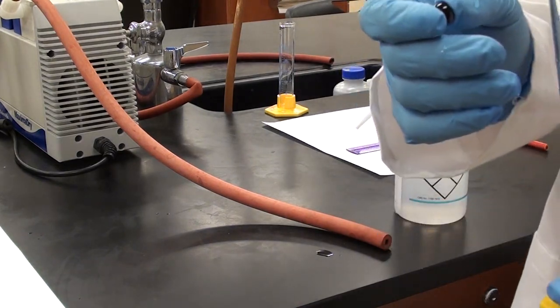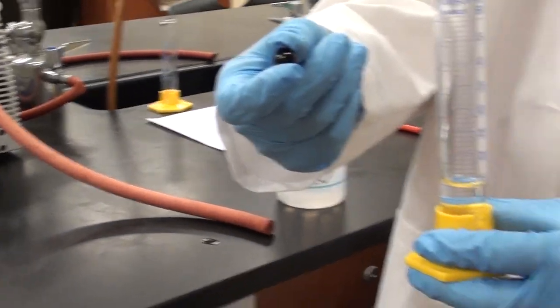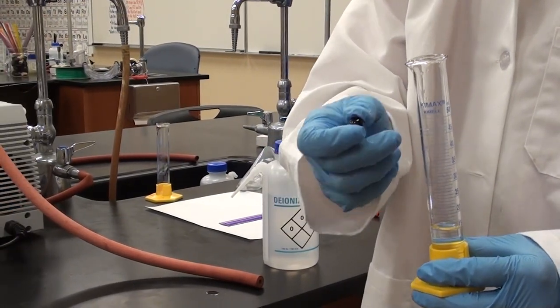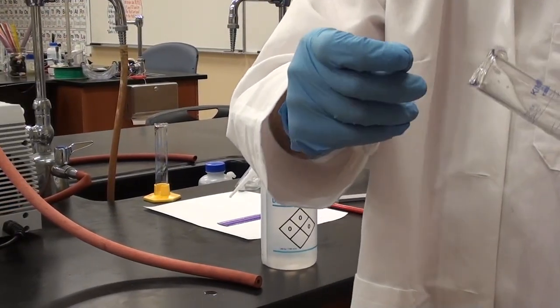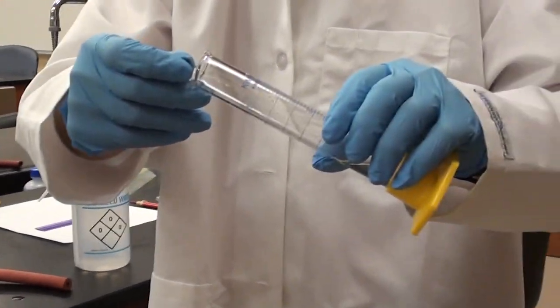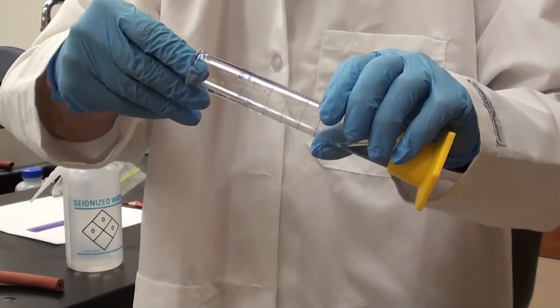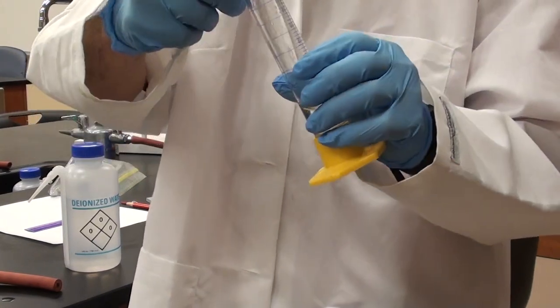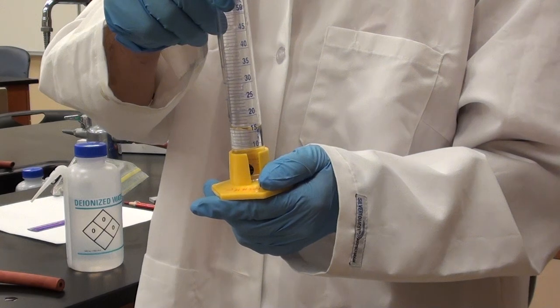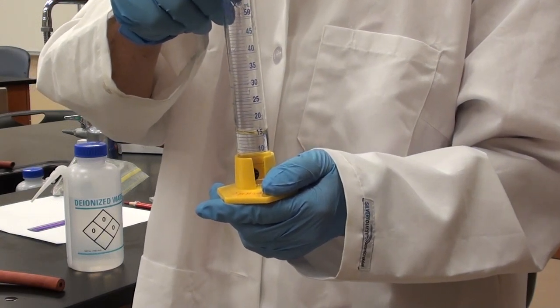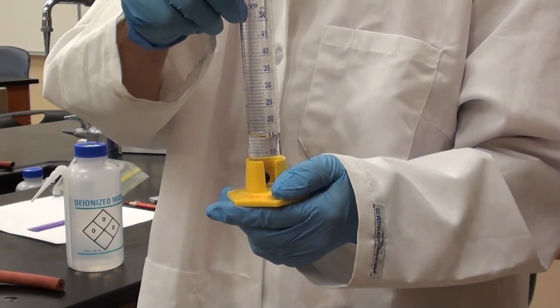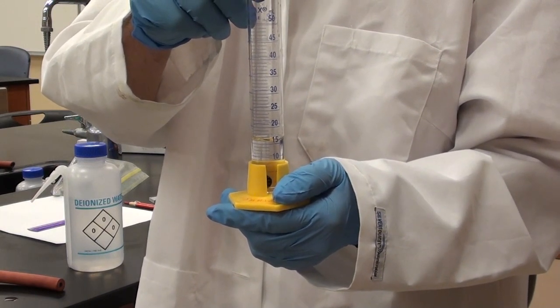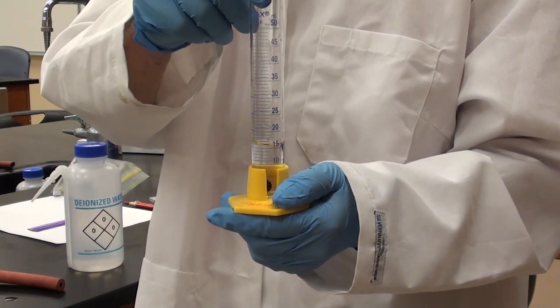Now what he's going to do is he's going to add the glass sphere. He's going to add this very carefully. He's not going to just plonk the thing in there. He's going to put it in slowly at an angle. Perfect. So we don't splash any of the water out either or break the graduated cylinder. So then we will re-measure now what the new volume is and the difference then will be the volume in the glass sphere.